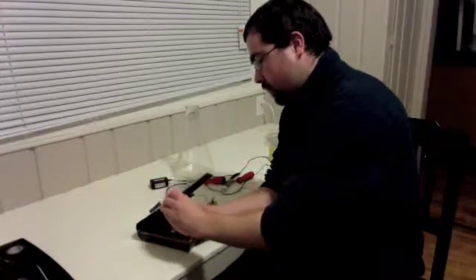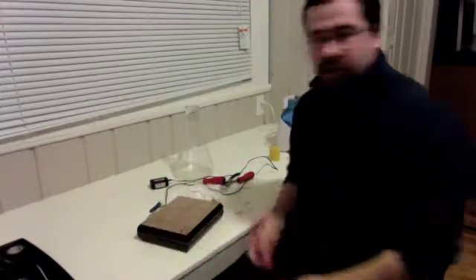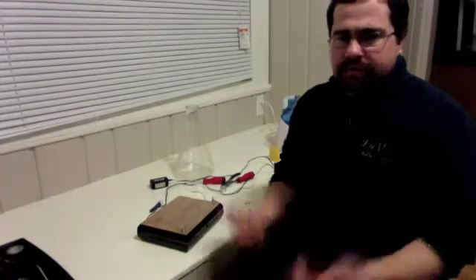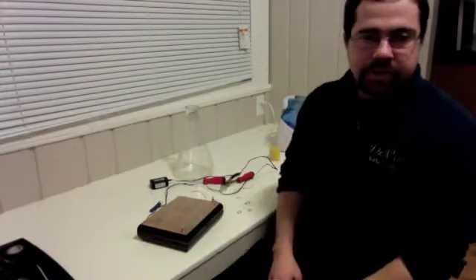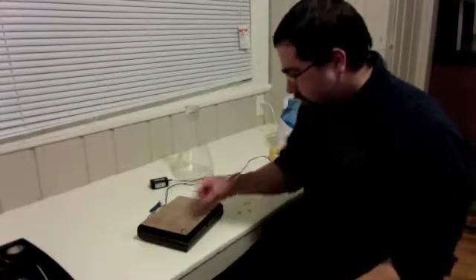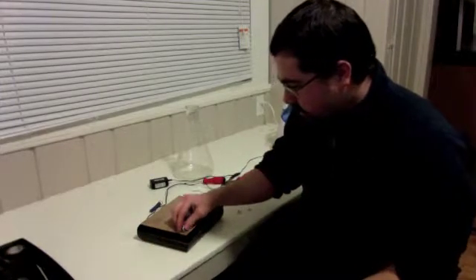How long did it take you to make the hole? Oh, I just used a knife and bored it out. If you end up using a cigar box, 5 minutes with a pocket knife. This is all cedar, so it's relatively simple and soft wood. Just curious for our viewers. Yeah.